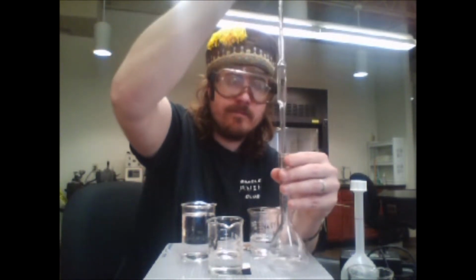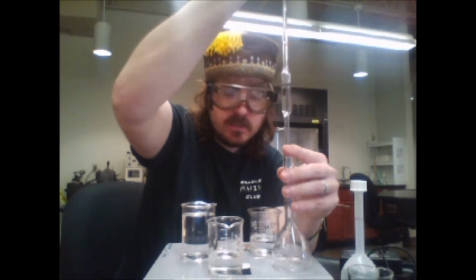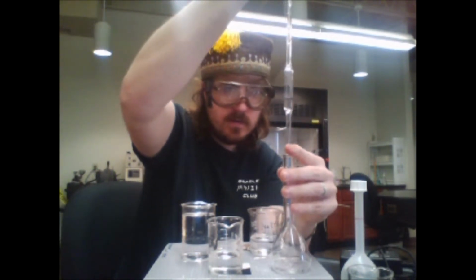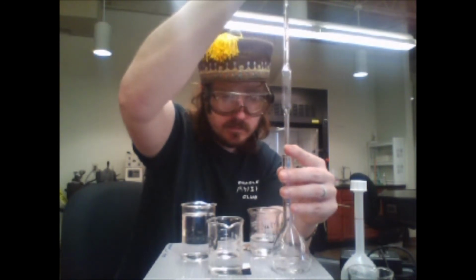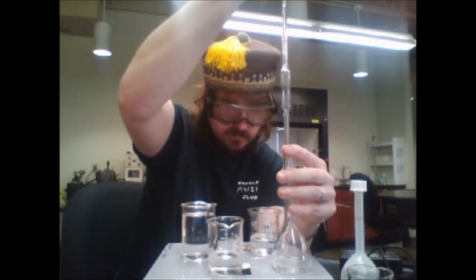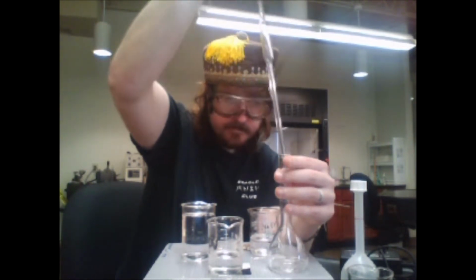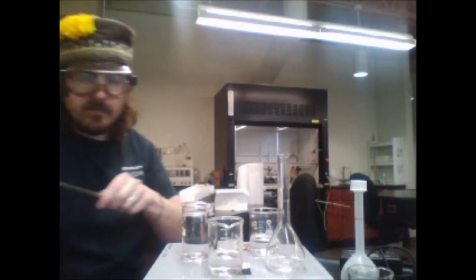I press the release and it's all being transferred into here. Okay. I'm done with this piece of equipment.